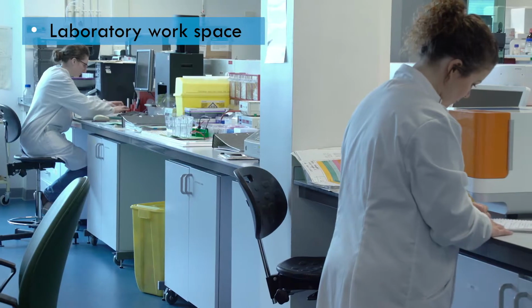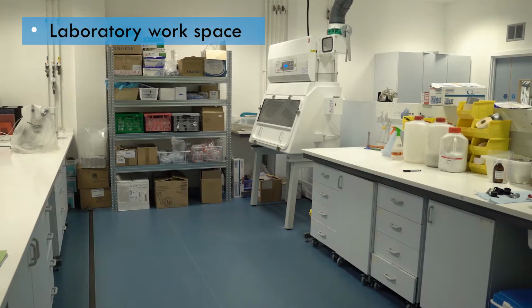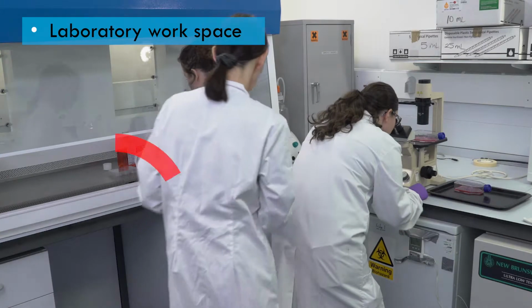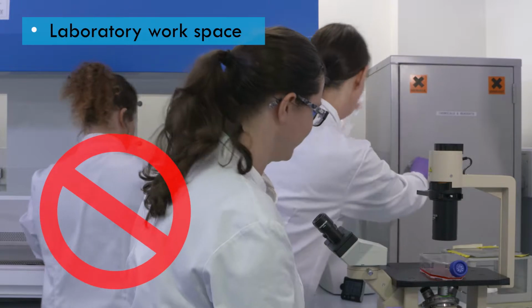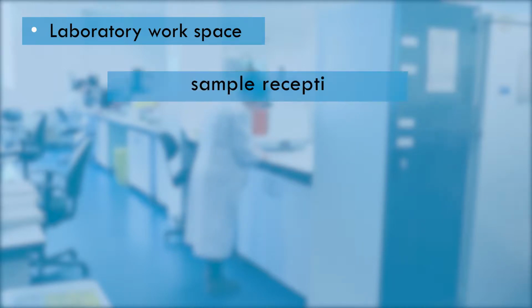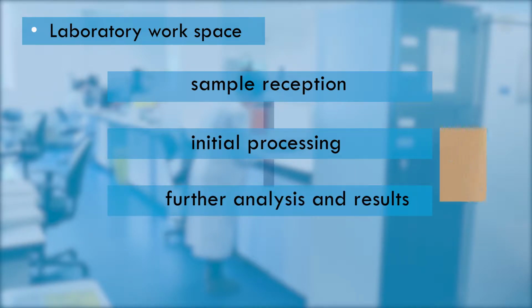Laboratory design and setup are important factors for good workflow. The equipment and materials needed for particular tasks should be close at hand, and there needs to be sufficient and well-organized space so that staff can work without getting in each other's way. It's best practice to have a one-way flow of work. For example, an area at one end of the laboratory to receive samples, which would lead into an area for initial processing, then on to further analysis and checking of results, and finally to disposal of waste.